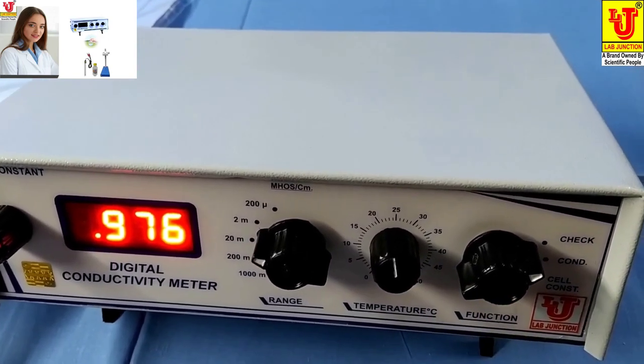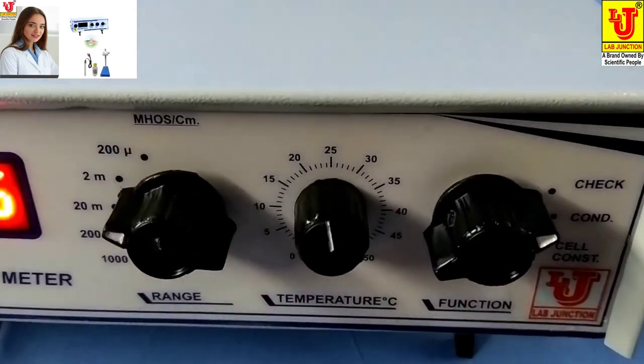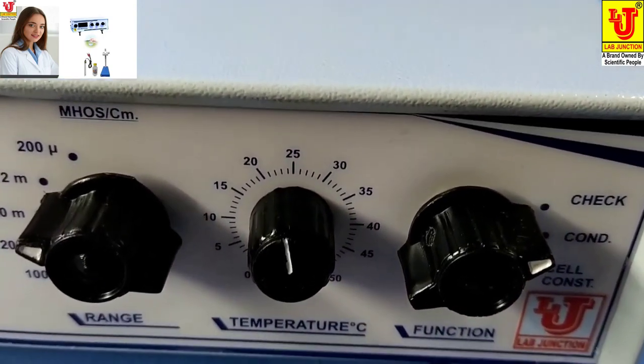In the function control, three positions are there: Check, Conductivity, Cell Constant.